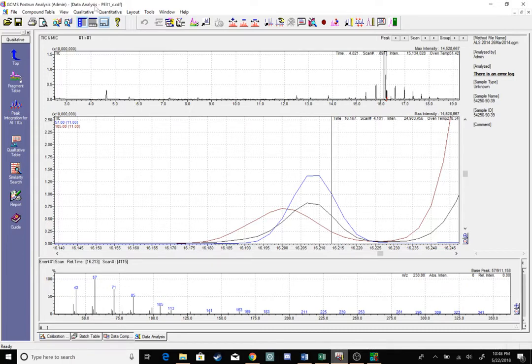So right now, in this PE31 data file, I can tell I have co-elution under this black peak at about 16.2 minutes, because I've plotted the two fragments that I noticed within it, my 57 in blue and my 105 in brown. You can tell that my 105 fragment peaks a little bit early at about 16.2 minutes, whereas my 57 fragment peaks a couple scans later at about 16.21 minutes. Being that these two primary ions have different trajectories, I'm thinking of co-elution.